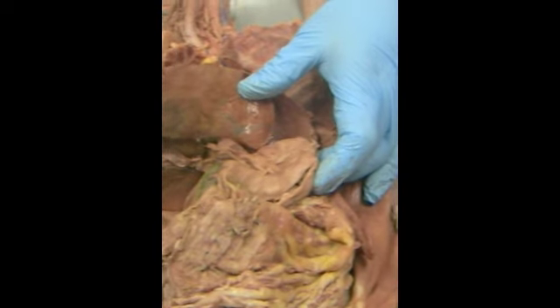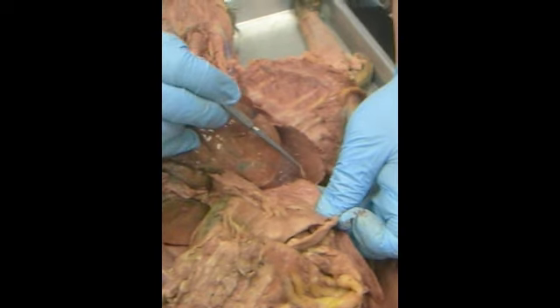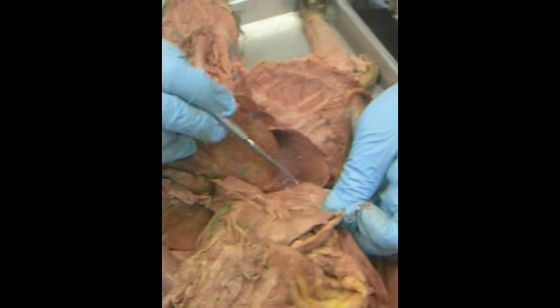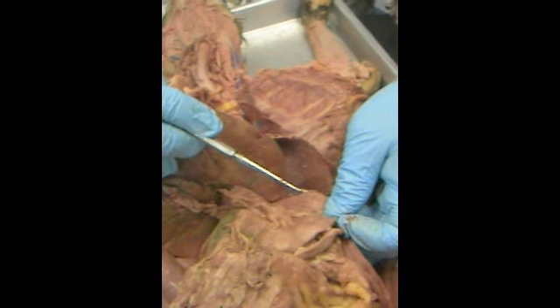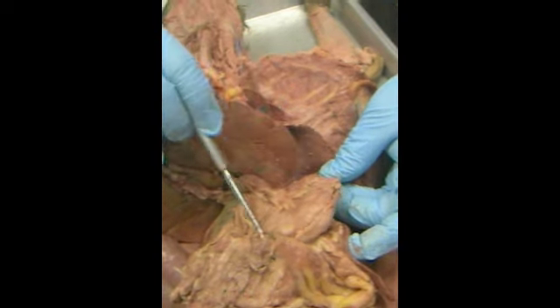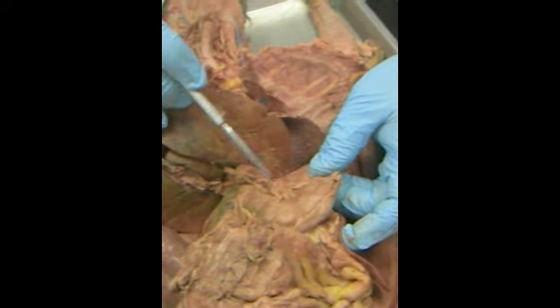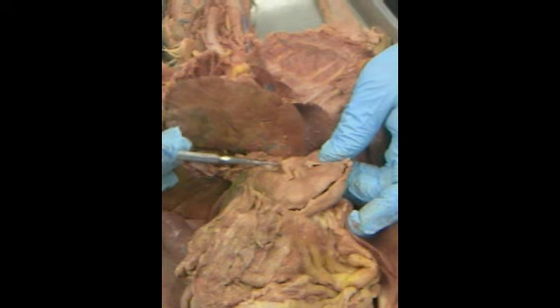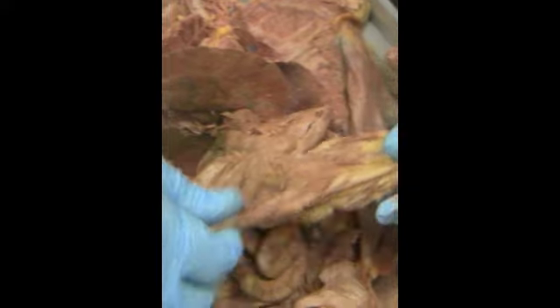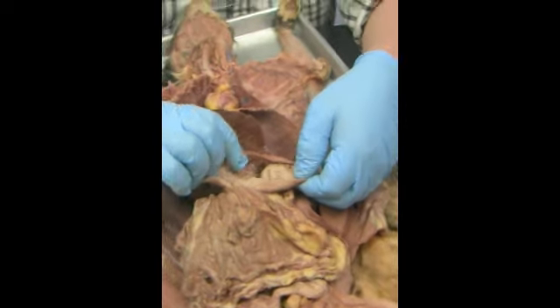Stomach is a J-shaped organ. At the top we have the cardiac portion. The outside dome is called the fundus. The bottom portion here is called the pylorus, and the middle part would be called the body. The outside edge is called the greater curvature. The inside edge is called the lesser curvature. This piece of schmutz in here is the lesser omentum. This big fatty apron is called the greater omentum. If we look inside the stomach, we could see rugae, the ridges.